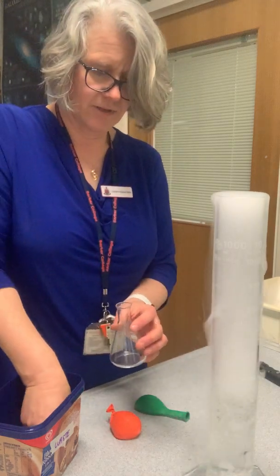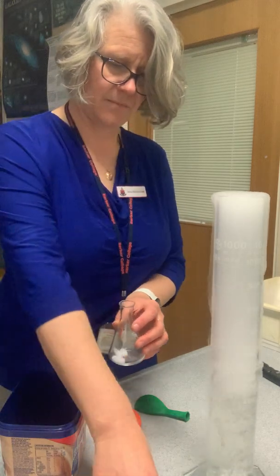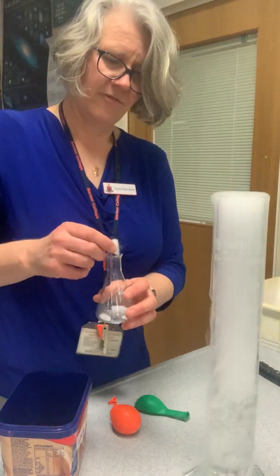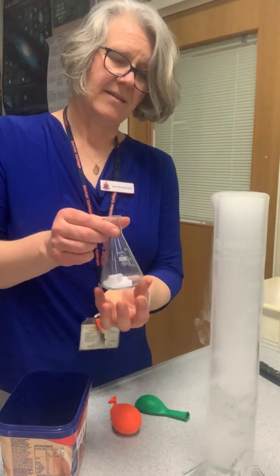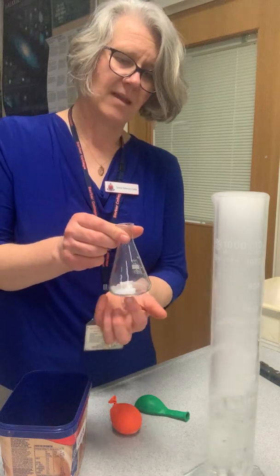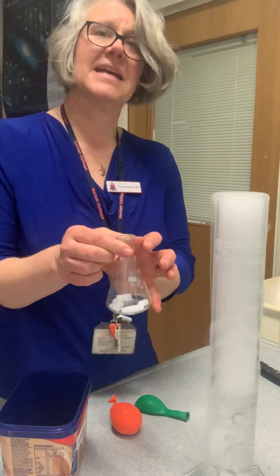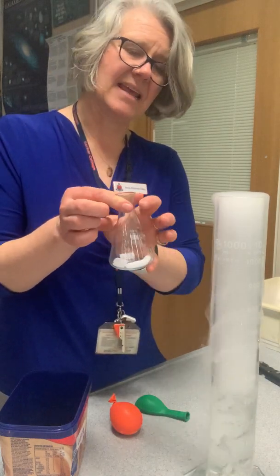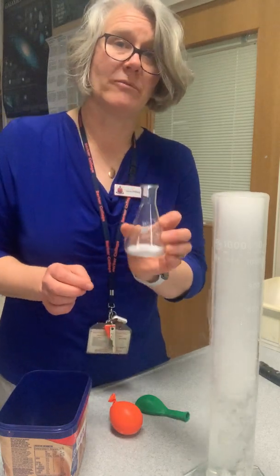Now the next thing I'm going to do is I'm going to put some of this dry ice in this little beaker here, and that's just going to fill it up for a while. And we'll see what happens as carbon dioxide goes from being in the solid form to being in gas. And carbon dioxide is actually heavier than air, so it's actually going to stay contained in here. You won't be able to see it, but we will be able to pour it out and get it to do a job for us.